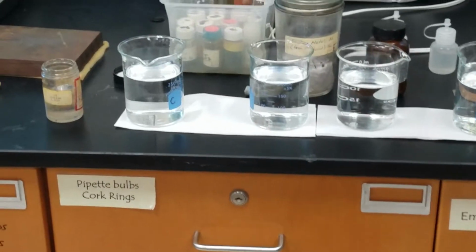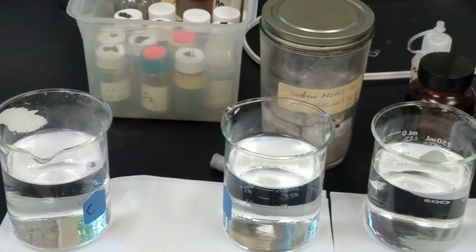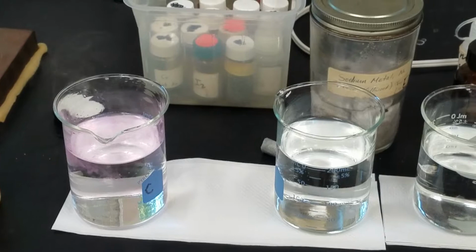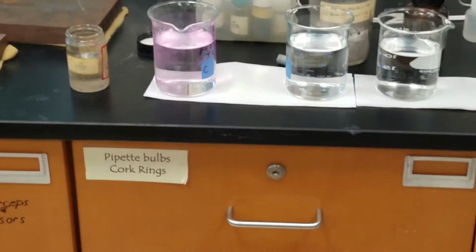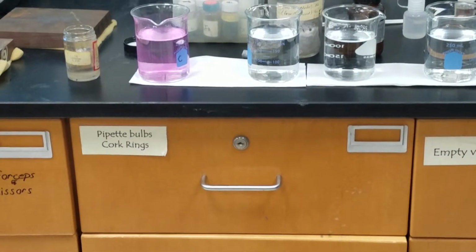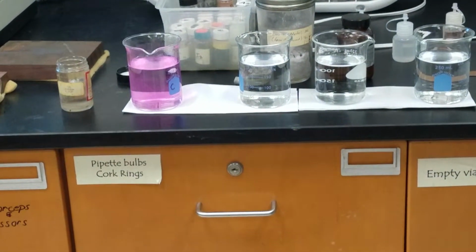So what do we notice about the reaction? It's pretty violent. Not too bad. You see the bubbles coming off? What are those bubbles? Hydrogen? Yeah. So lithium is losing electrons going to the lithium ion, the hydrogen in the water gaining electrons to go to hydrogen gas. And what we want to compare is this rate of reaction.